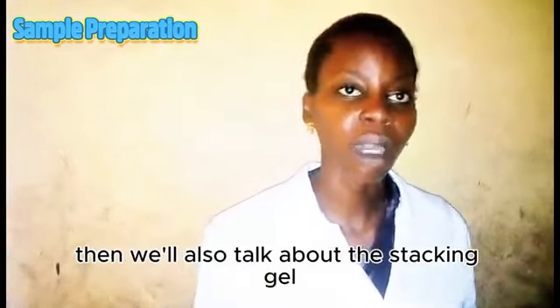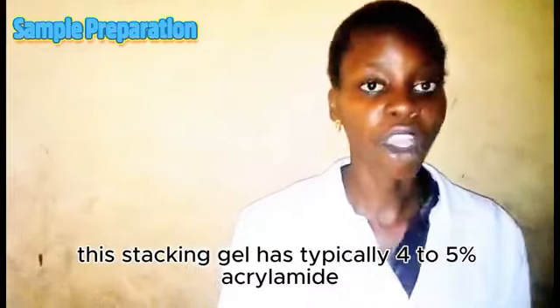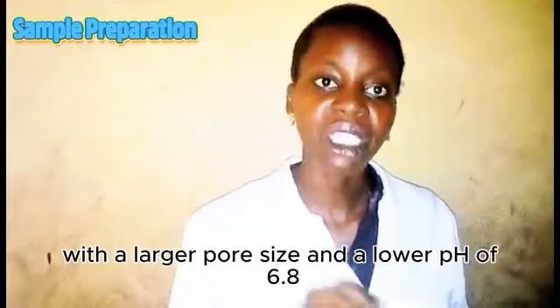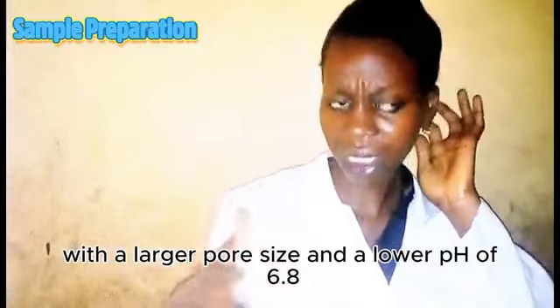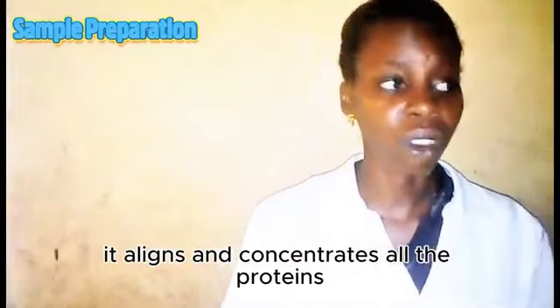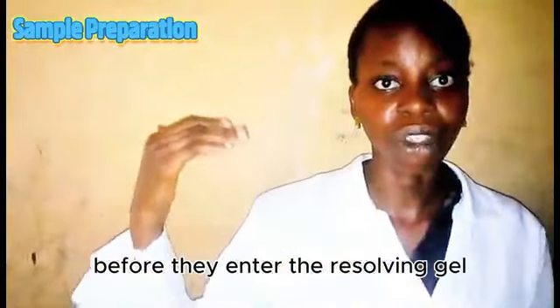Then we'll also talk about the stacking gel. This stacking gel has typically 4 to 5% acrylamide with a larger pore size and a lower pH of 6.8. It aligns and concentrates all the proteins into tight bands before they enter the resolving gel.